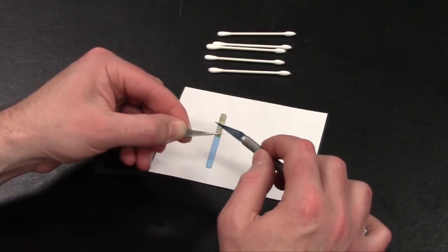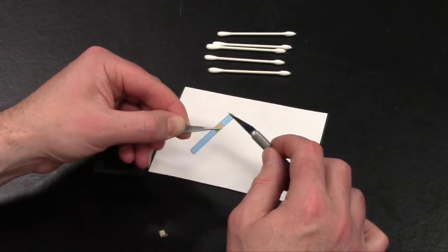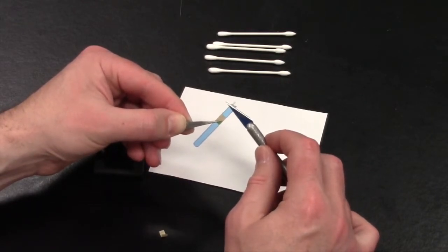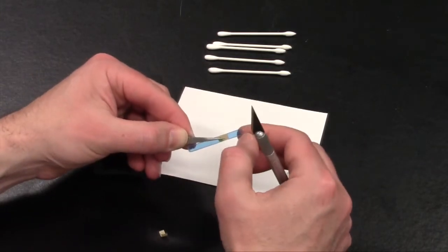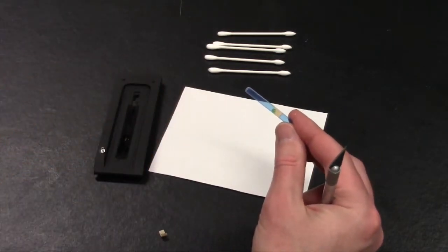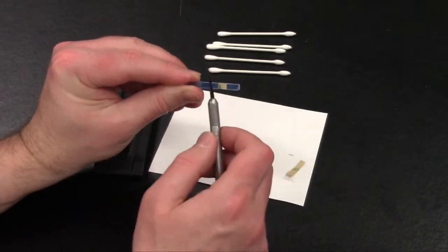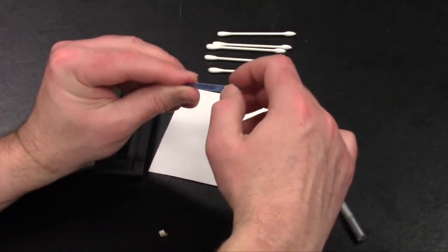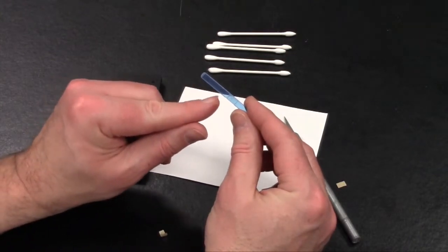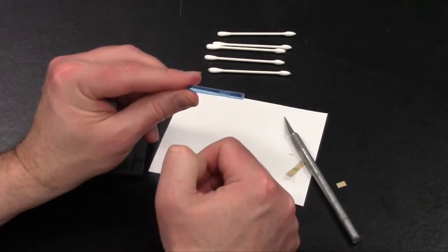So once the top and the bottom pieces of the adhesive have been removed, what we want to do is then carefully, and these might be a little tricky, holding the lens by its side, go ahead and remove this last piece in the middle. And if you have to, you can use the tweezers, or you can carefully use your hand to remove that piece. So what we want to do is look to see that there's a large window of the lens and then a smaller window with a piece of adhesive in the middle.